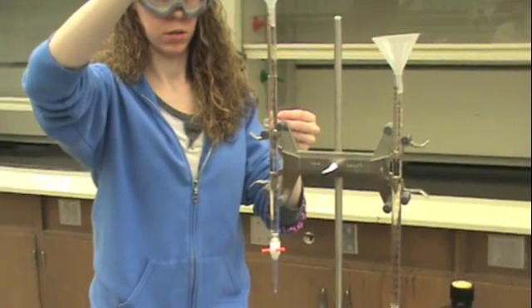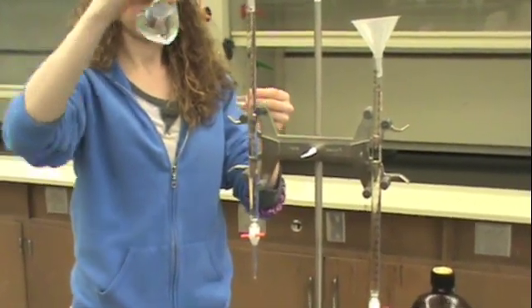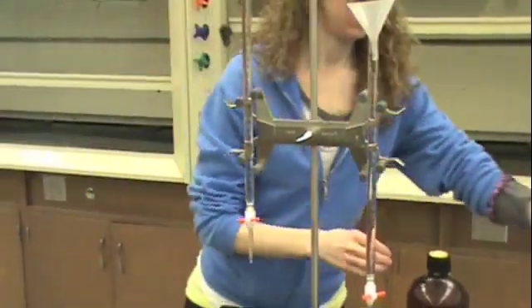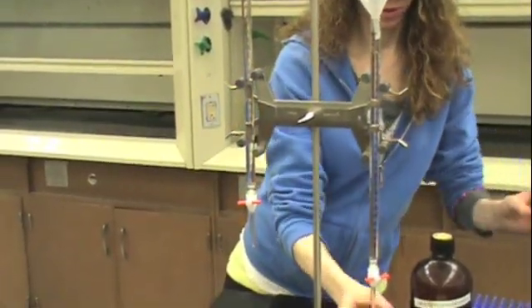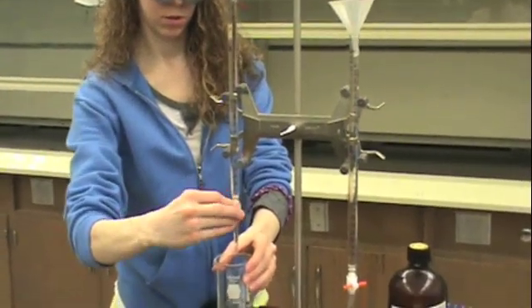You'll want to do this so that you have an accurate measurement of how much of your concentrated solution you're putting into your diluted solution. This should be a clean burette and then you'll want to drain the excess amount that you put into the burette.